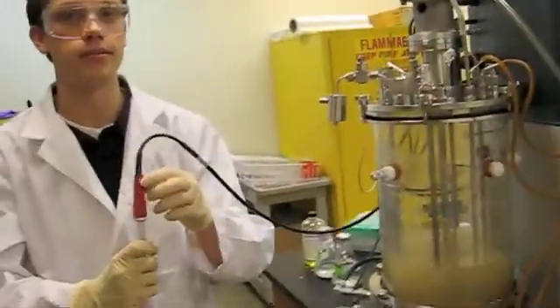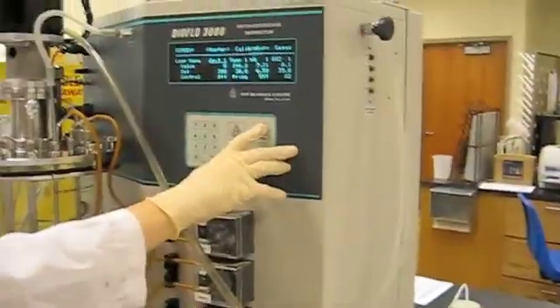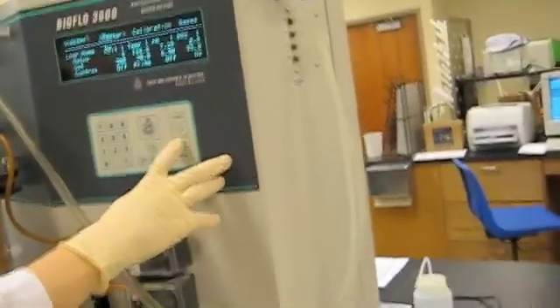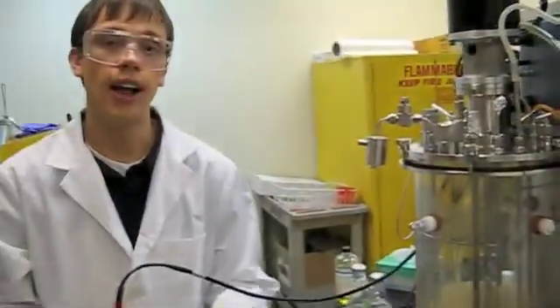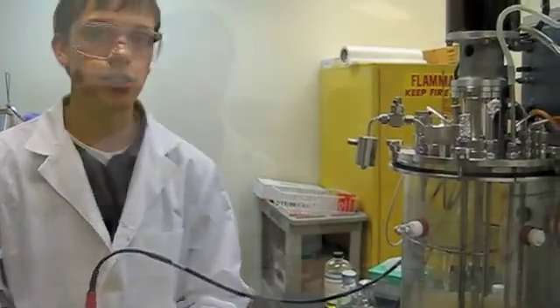All right, now we're going to calibrate. So we're going to adjust the screen by pushing the screen, we're going to adjust it to calibration. And we're going to calibrate it using three buffer solutions of pH 7, pH 10, and pH 4.